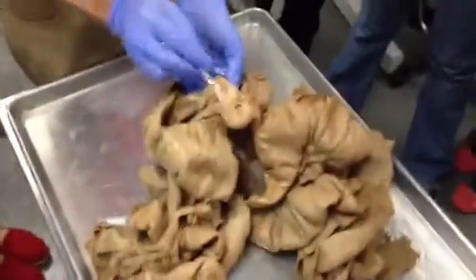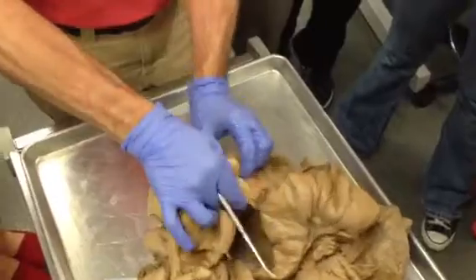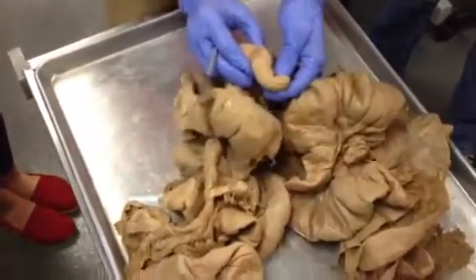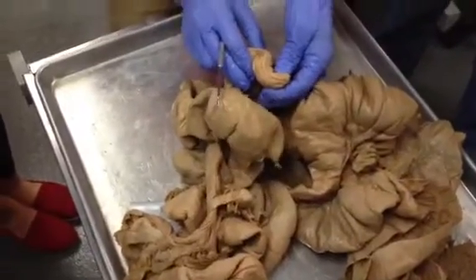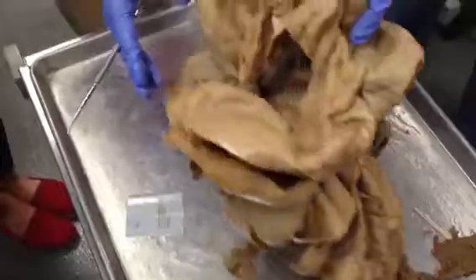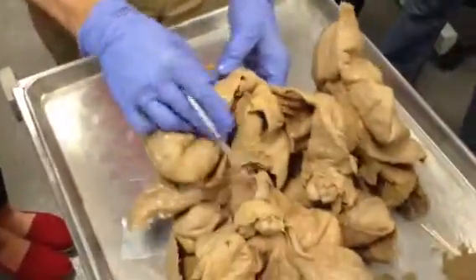Twisted type of tubule is vagina or cervix. I'm not a veterinarian, so it's somewhere around there, vagina or cervix. But then, in fact, I got to do something here. Oh my God! But then something weird happens.